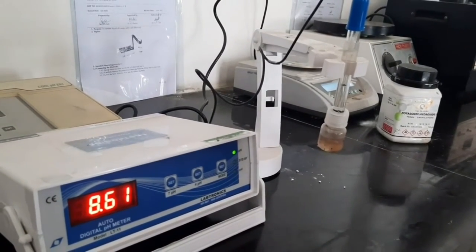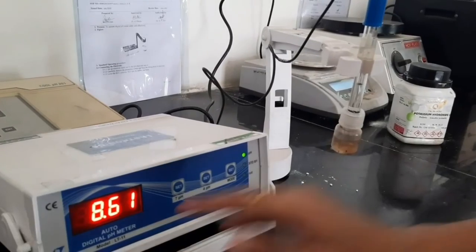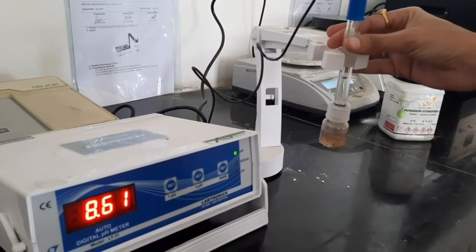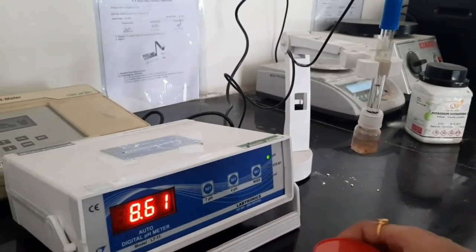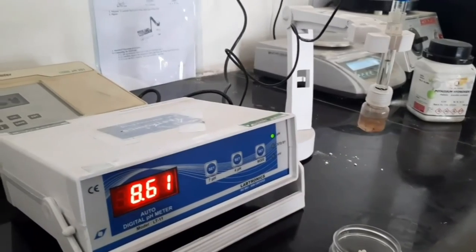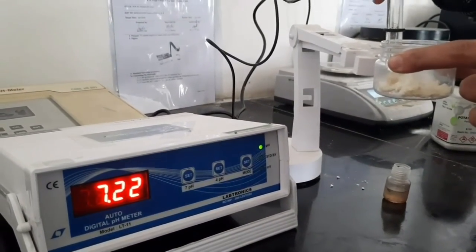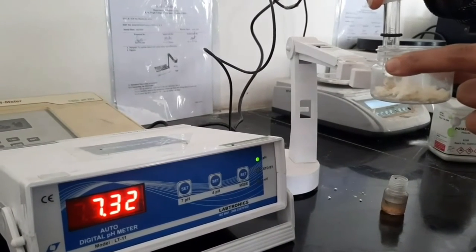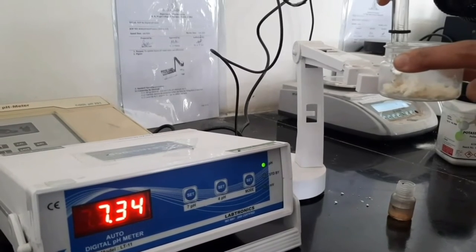Now we will check the pH of the formulation using a pH meter. The electrode of the pH meter has been dipped into our formulation, and the pH of the formulation is 7.35.